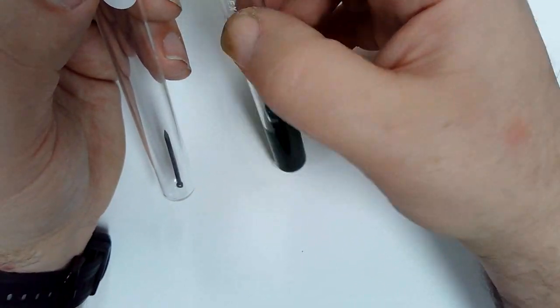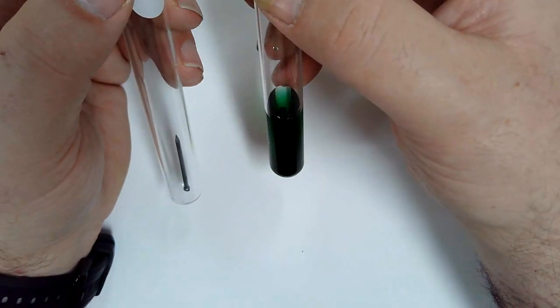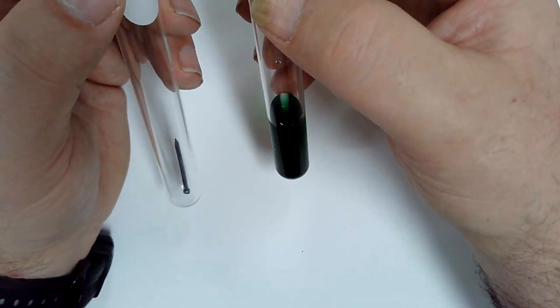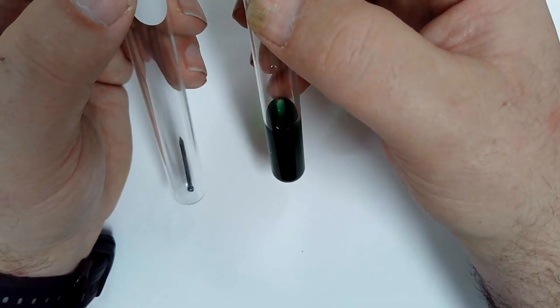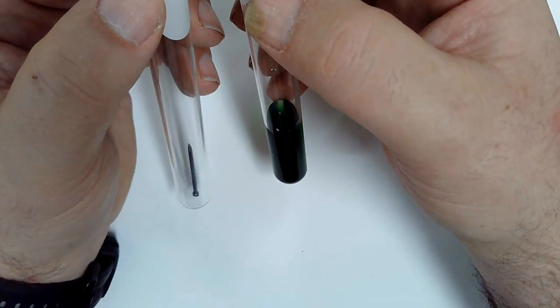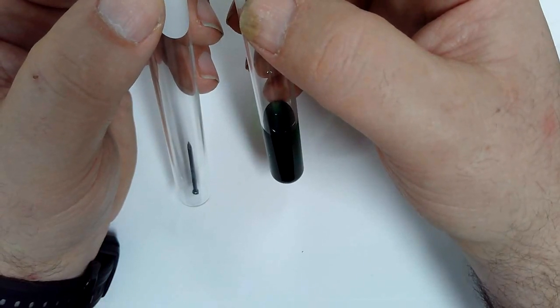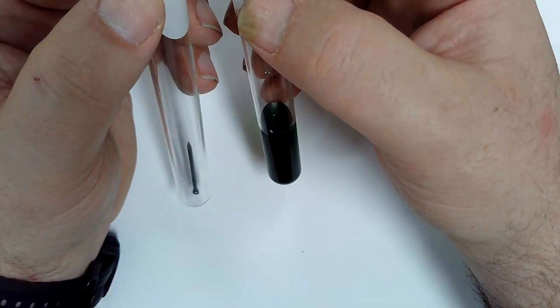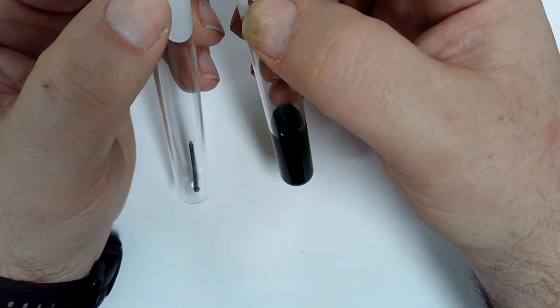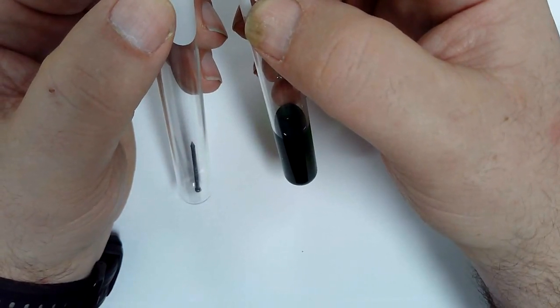It does a couple things. Number one, it falls off. It's what makes it look a little darker. Two, it clears off that surface area, so the solution has contact with clean surface of iron, so it reacts really fast again. If we were to still teach reaction rates, agitation is something you can use to speed up a reaction, because anytime I can flush the surface area with clean solvent, I'm causing the reaction rate to increase.